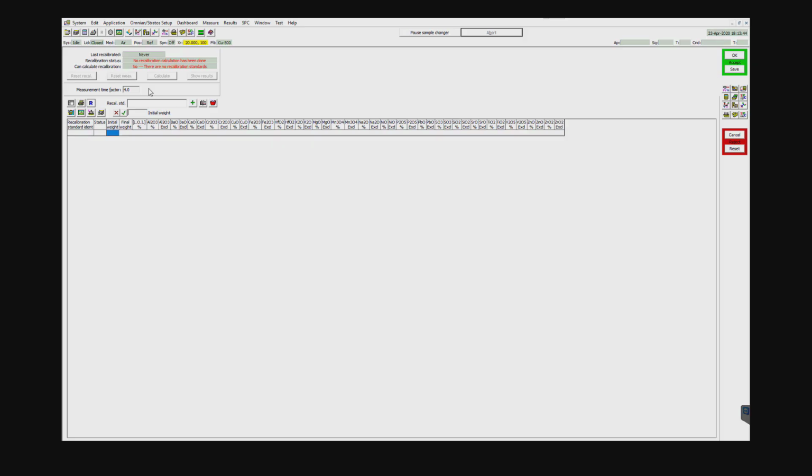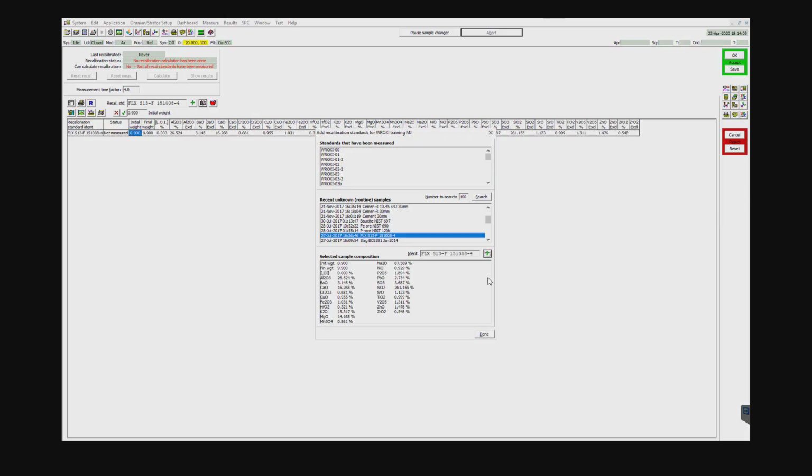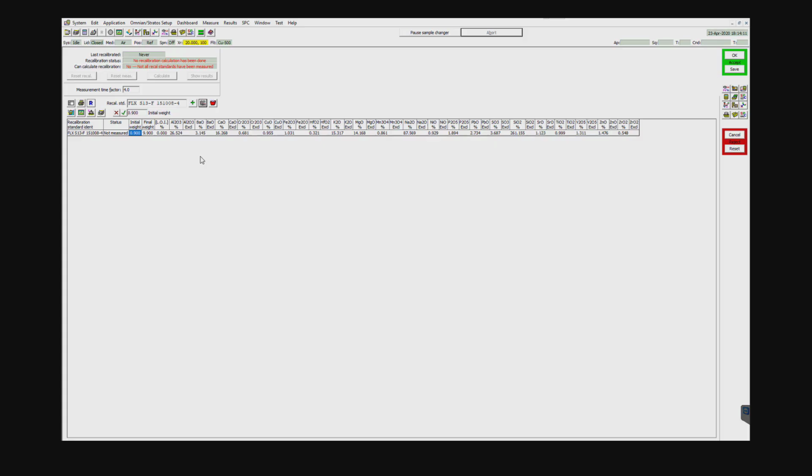So today, after I did the application calibration, I ran the FLX S13 sample against the curve. That sample is a glass bead. So I'm going to go ahead and open it from the book. And I'm going to go down here from recent unknown routine samples that were measured, and I'm going to find FLX S13. And I'm going to hit this green button to add it. And I'm done. So all I'm going to do today is a slope correction.